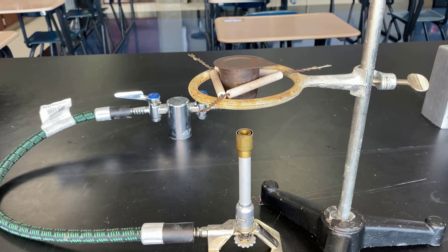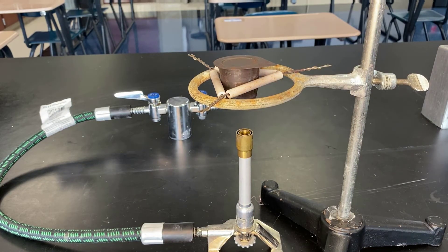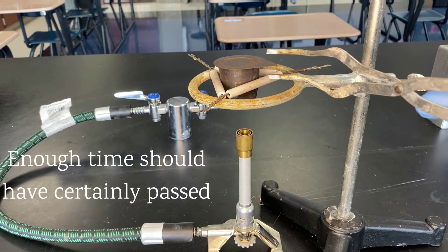Part of this is due to a high school environment where you only have a certain amount of time to do the experiment, and you can only allow so much time for it to cool, re-oxygenate the vessel, and then reheat it.